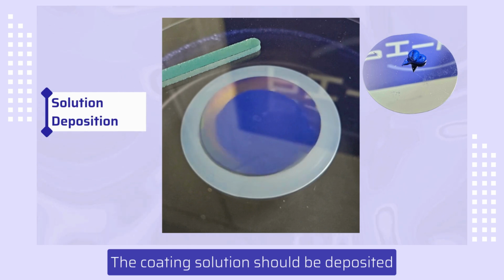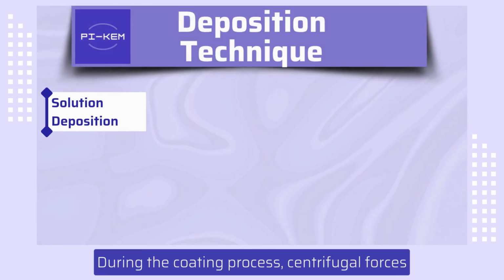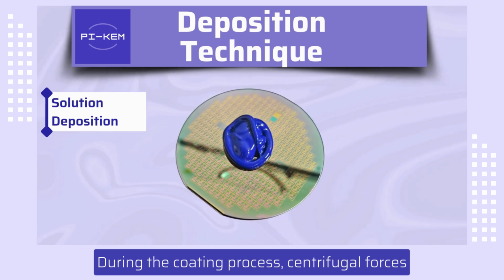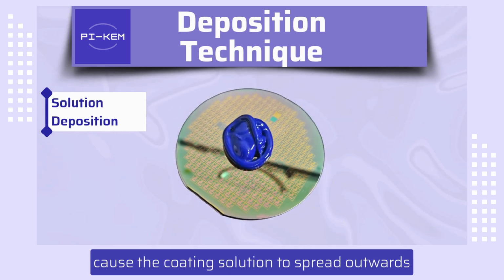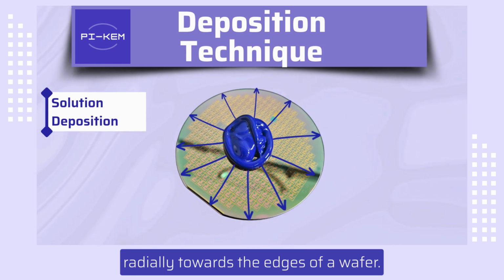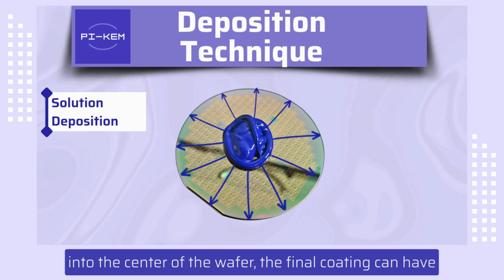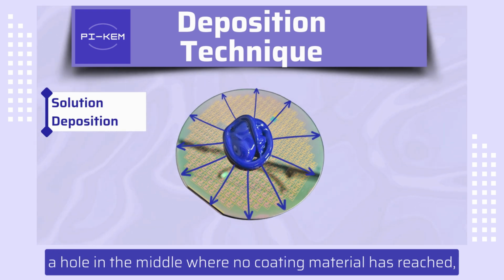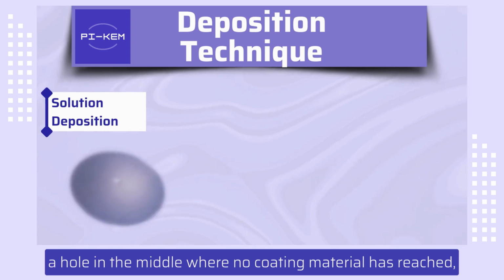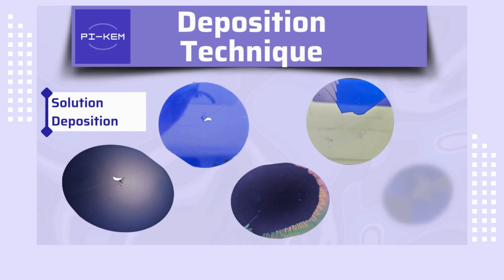The coating solution should be deposited centrally onto the wafer surface. During the coating process, centrifugal forces cause the coating solution to spread outwards radially towards the edges of a wafer. If the coating solution is not deposited precisely into the center of the wafer, the final coating can have a hole in the middle where no coating material has reached, resulting in incomplete coverage of the substrate surface.